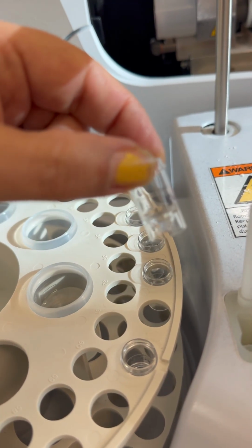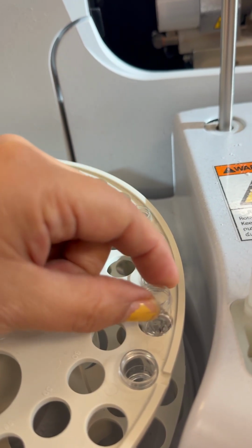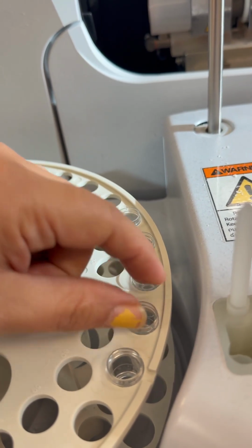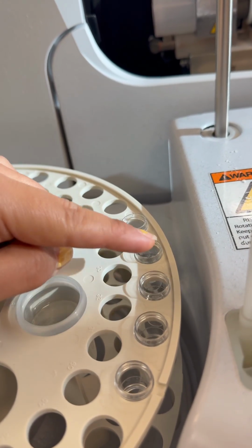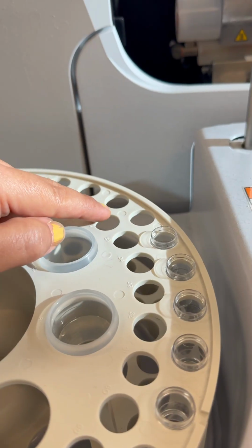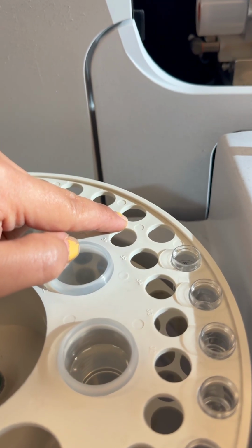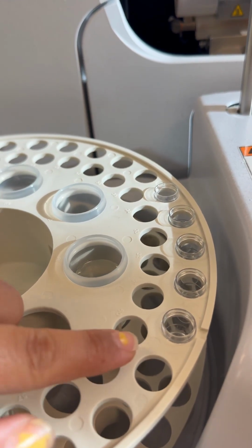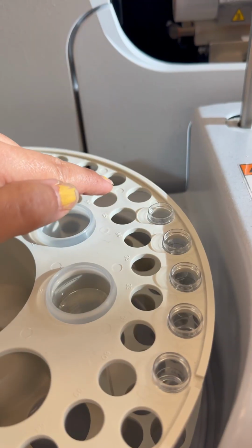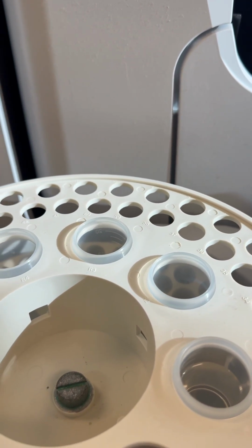It takes only a small amount. Put it here. You can use a plastic pipette. Put it here, and then 1 sample here. Then you're gonna put another sample, 5 samples. The next person is gonna come and start from number 7, because the first was the blank, then the 5 samples, so it's gonna be 7, and as we go on we're gonna start filling up.